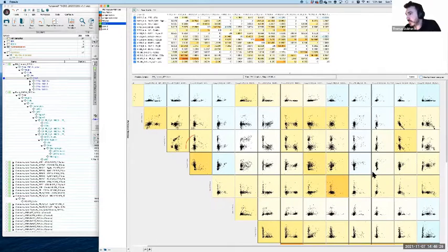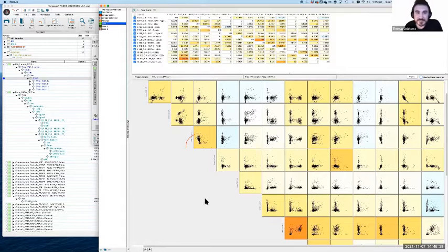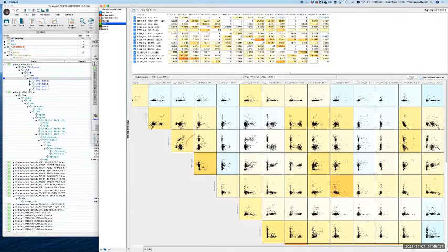Any others anyone can spot? Yes. Hello. Hi there. I saw in the second row on the right, and on the last two plots, overcompensation. Yeah, definitely. Let me get rid of my squiggles. And what we'll have a look at here is that this is in fact the same problem, and it's just showing up in multiple places. Very well spotted. That's probably the most obvious one, where it's like, yeah, okay, that looks like a pretty serious issue. Cool. I think my notes are right.